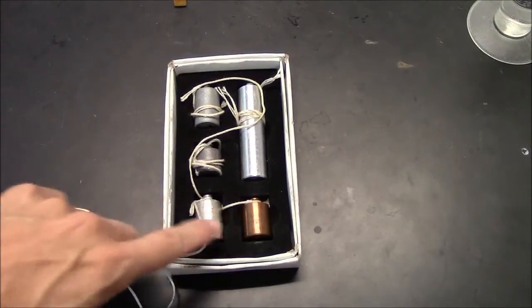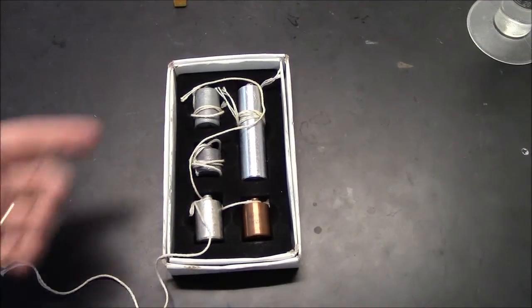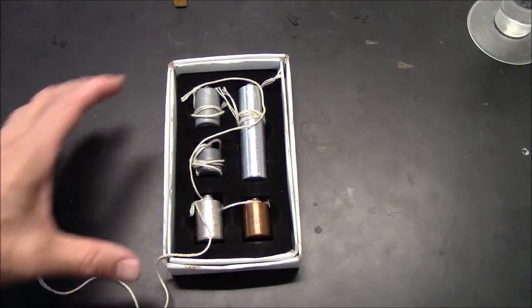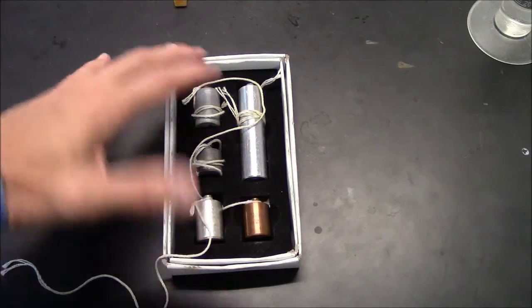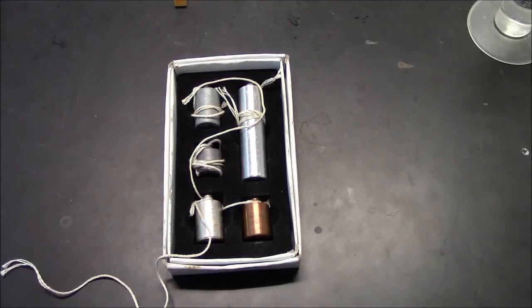These 5 known metals are a kind of practice for you. Since you know the density of these metals, the official value, you can determine how successful your methods are. So you want to make sure that you're getting these right, quote unquote, before you move on to the unknowns.